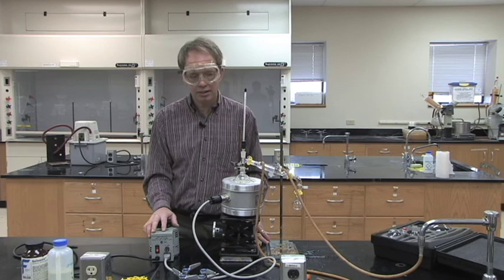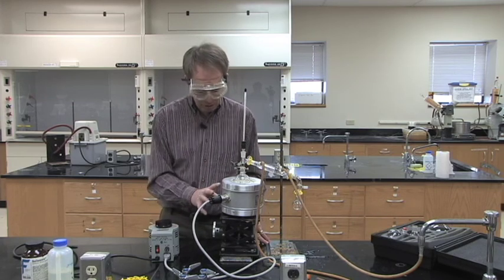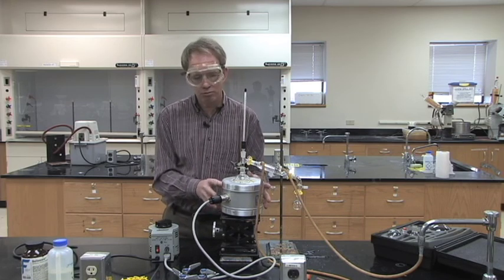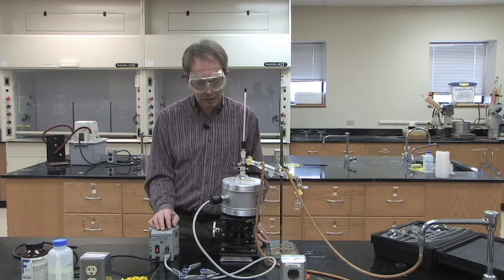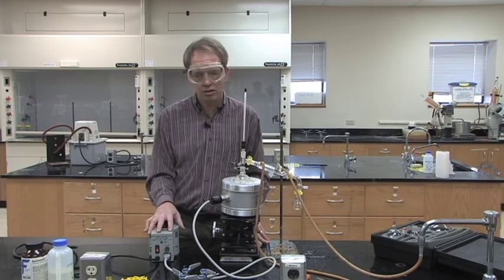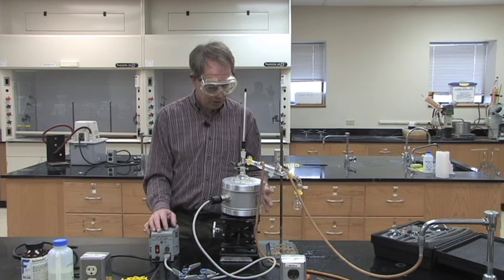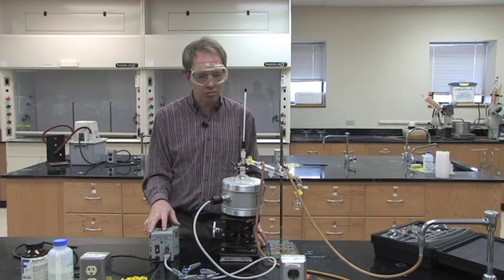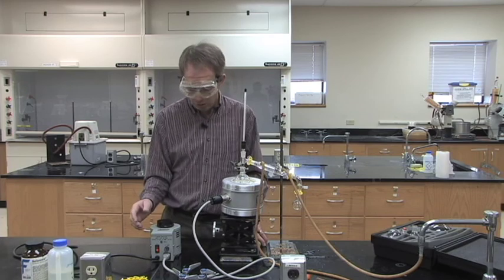If you're not sure anything's happening to it, talk to your professor and have him come over and check. Sometimes, depending on what thermal well you use, we may end up blowing a breaker in the electrical box in the lab. And if that happens, all we have to do is go over and flip the breaker and start it over again. So don't sit for a couple hours with nothing happening. Talk to your professor if after 20 or 30 minutes, you're not getting any heat to your thermal well.